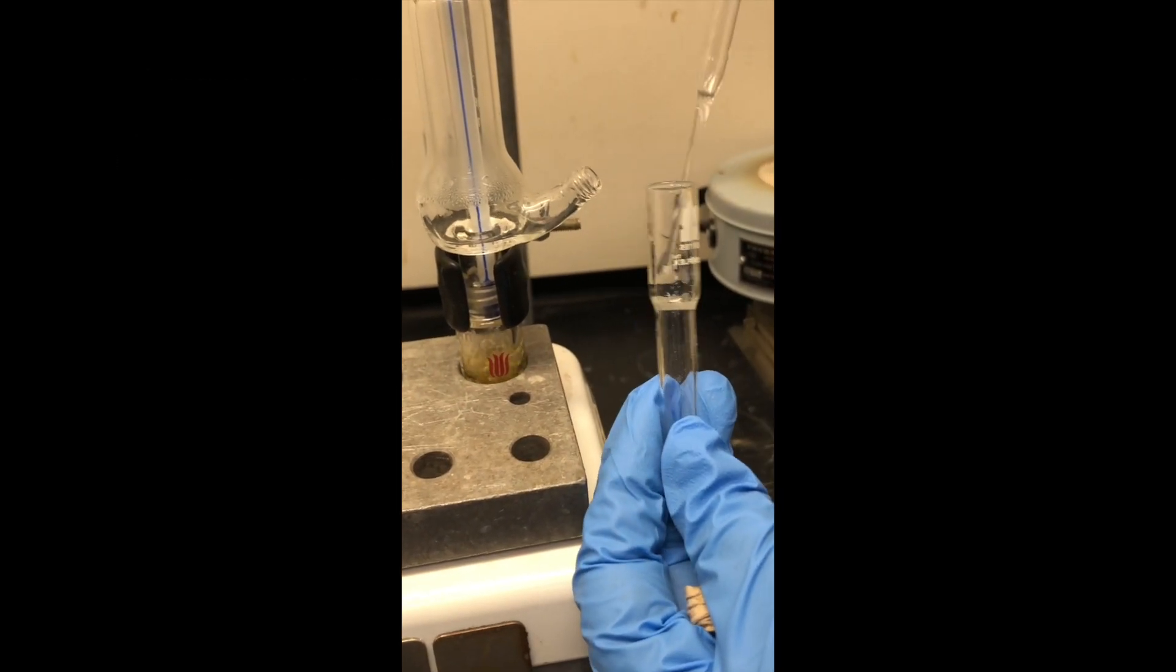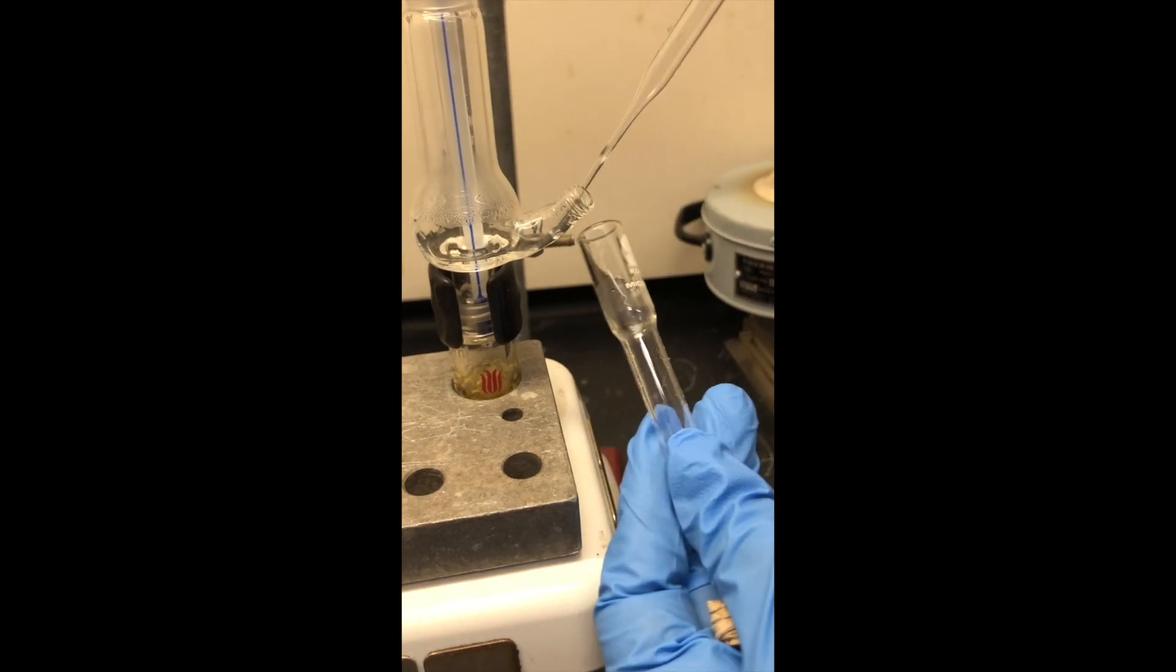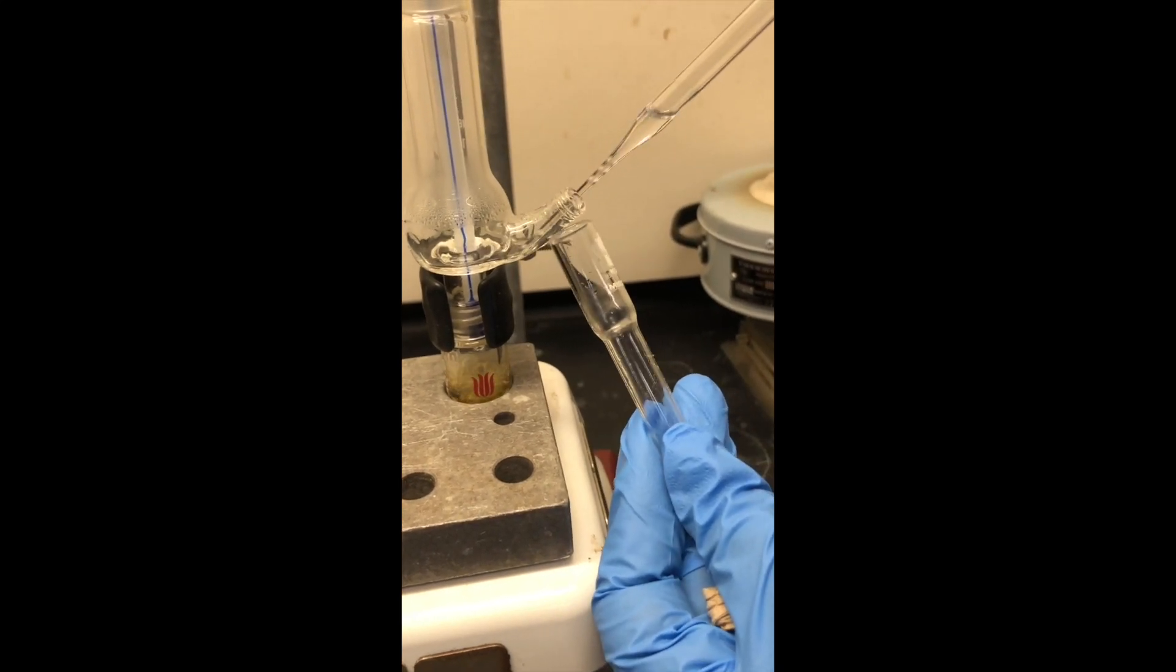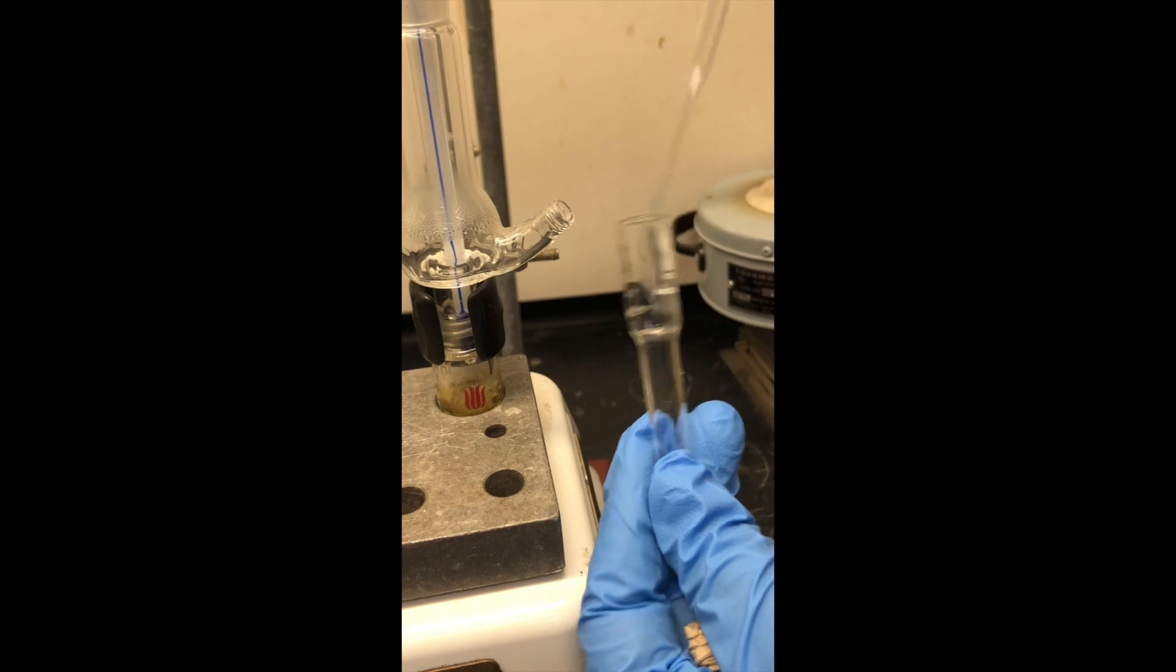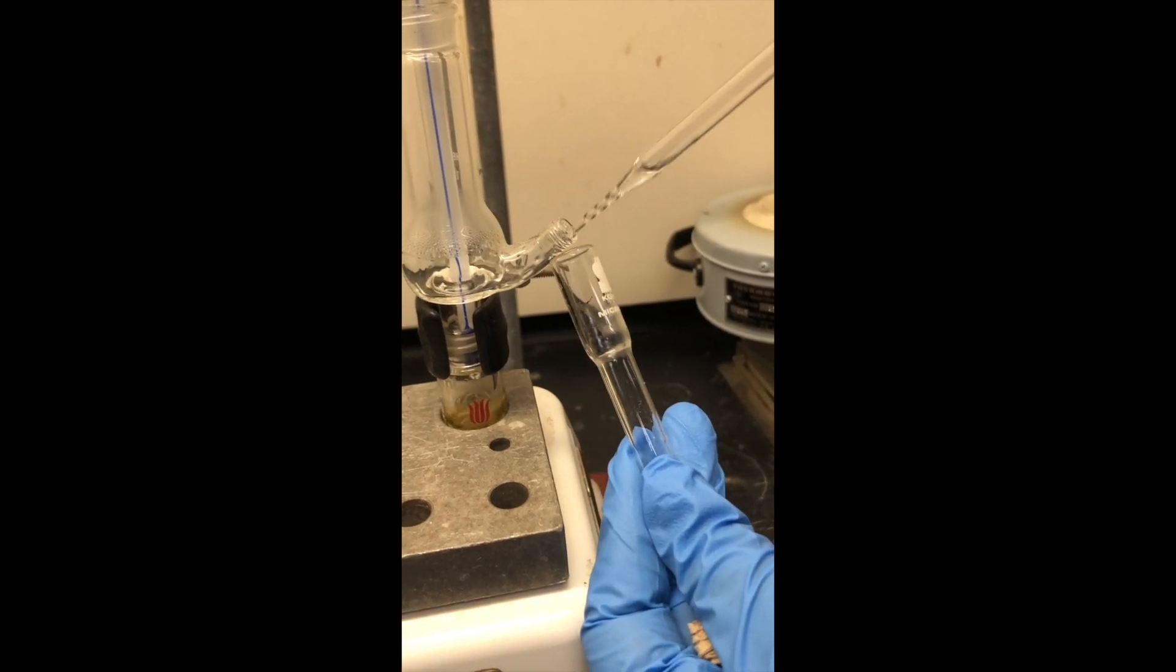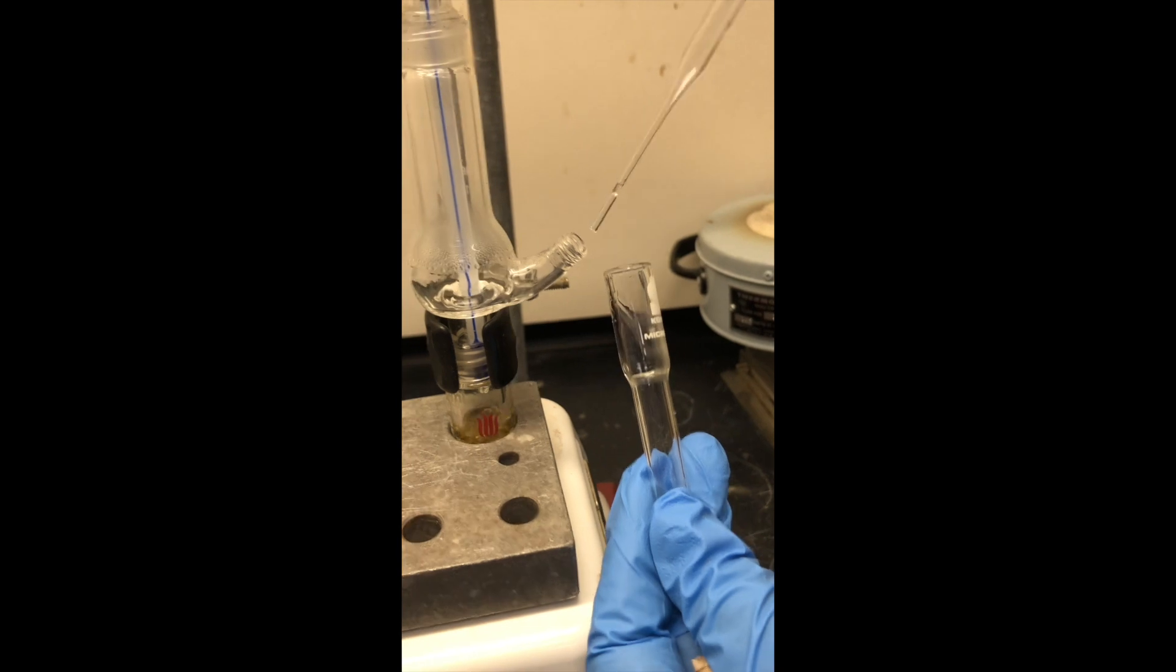So we're transferring the stuff through the port into the pre-weighed container. And you can see we've collected a fair amount of distillate there that Professor Ferretta is removing with great expertise.